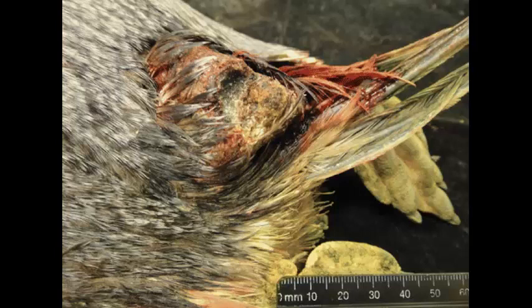Okay, time's up. We're looking at the back legs, here's the base of the tail. There's a large mass arising from what is known as the preen gland. The preen gland is a modified sebaceous gland that the animal reaches back to, gets some oils on its beak, and then rubs it on its feathers, so it secretes sort of a greasy substance.